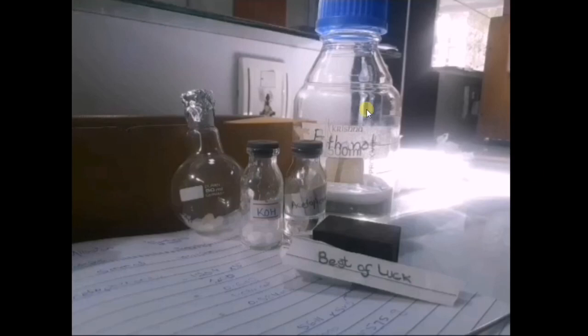In this video we will learn and also synthesize chalcones. For the synthesis of chalcone we need acetophenone and benzaldehyde as reactants, and to proceed the reaction we use a base, that is KOH, and we can also use NaOH, and the reaction runs in solvent ethanol or methanol. This is up to you which solvent you have. You can use either methanol or ethanol.